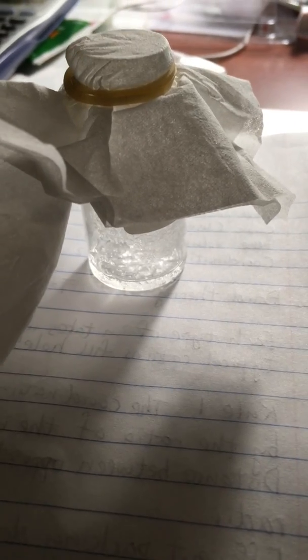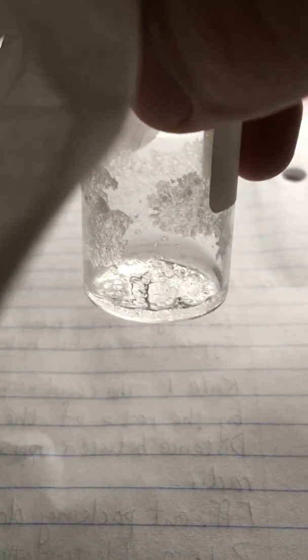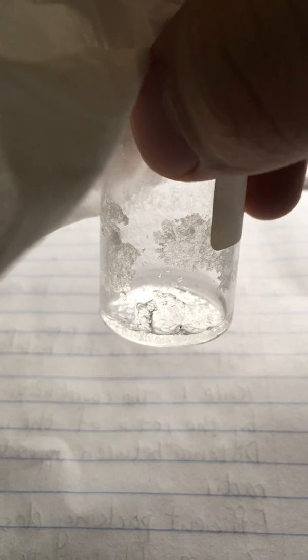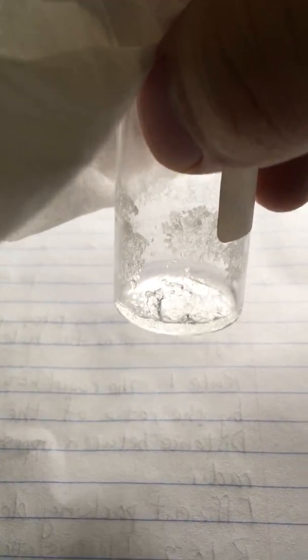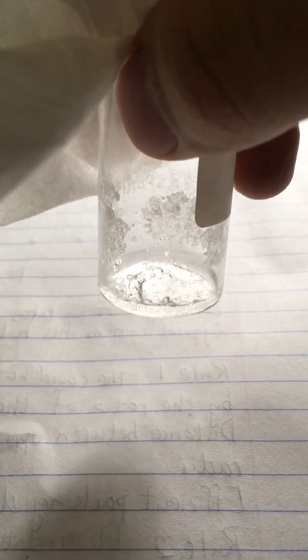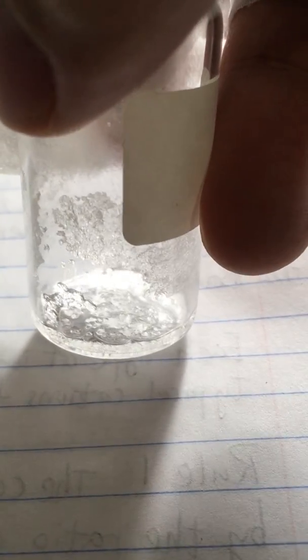Richard here. So today I'm going to continue commenting on the alum crystal growth. As you can see, the objective to grow a huge alum crystal failed for some reasons. I think the most important reason is that when I got the solution, I actually shook the solution quite a bit, but then vibration causes a nucleation process, so the entire process speeds up, and that's why I didn't get a huge crystal, but I still got some crystalline structure on the side of the container as well as on the bottom, so it's not too bad.